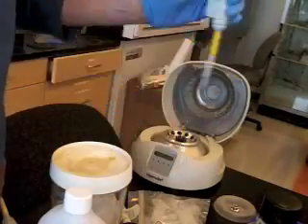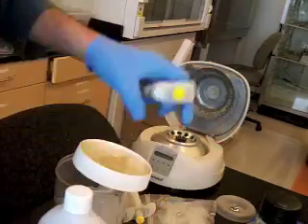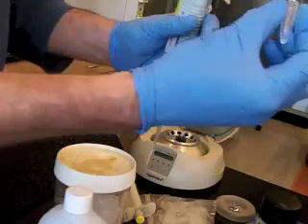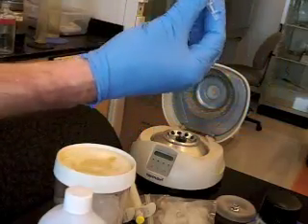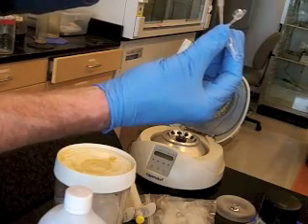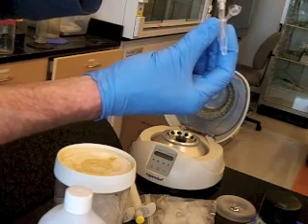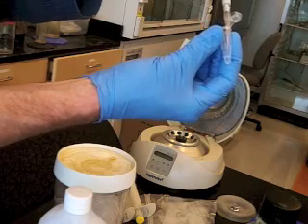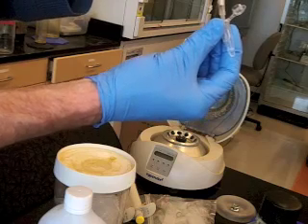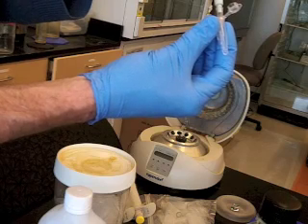And the way that we do that is we will hold the tube, we'll open the tube up, and we'll hold it with the hinge up, and we'll use the other wall, inner wall of the test tube to steady our hand and slide down the other wall. We know we can do that safely because any pellet is on the hinge side. So in other words, it's in the upper side. So we're going to slide down the inner wall of the lower side of the tube, and we can start withdrawing the liquid as far away from the pellet as possible.